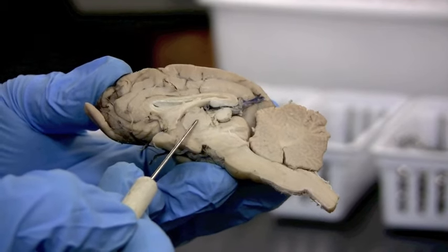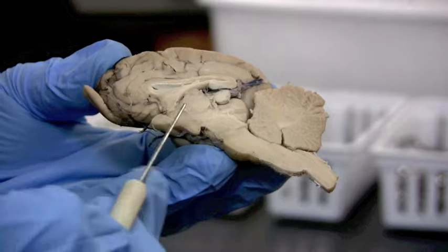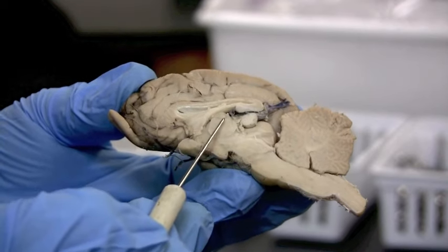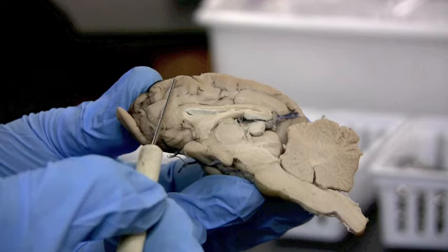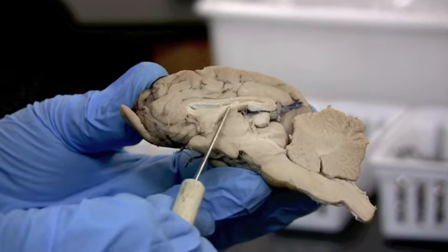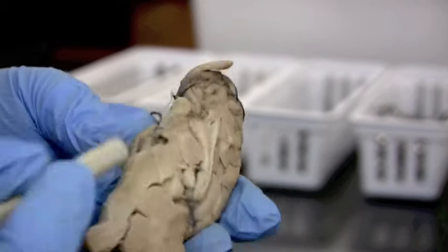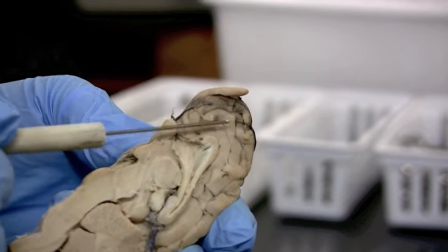The thalamus is the relay center. All the sensory information coming in from all these different nerve locations is going to go through the thalamus — there are different nuclei in here responsible for each different region. The information goes up eventually to the different cortices, different areas of the lobes of the cerebrum. Everything goes through the thalamus, except for one particular nerve: the olfactory nerve, with the olfactory bulb and olfactory tract, because it has a direct connection with the cerebrum and therefore doesn't need to go through the thalamus.